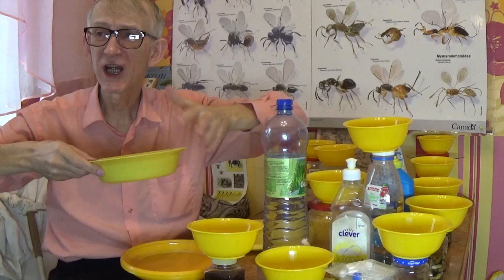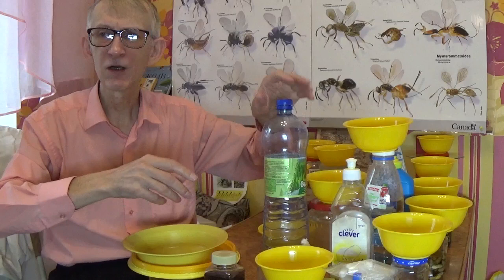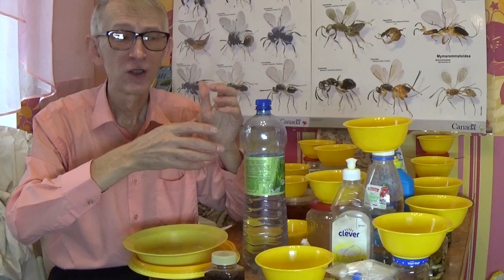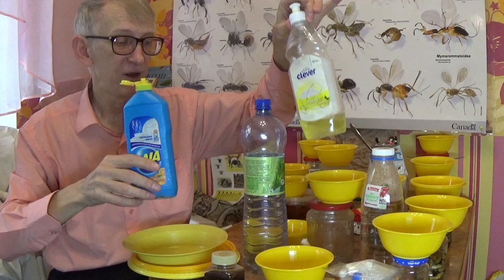You need to keep the trap in a stable position or check it more often. Inside the plate, you fill it with a collecting liquid: water with shampoo, or soft soap, or a special liquid used for cleaning dishes in the kitchen — very cheap, convenient, and easy to find.